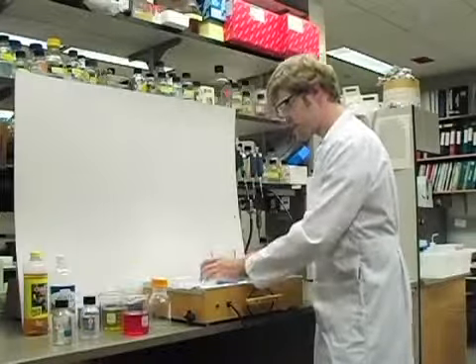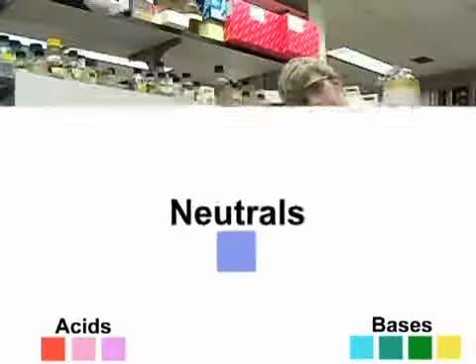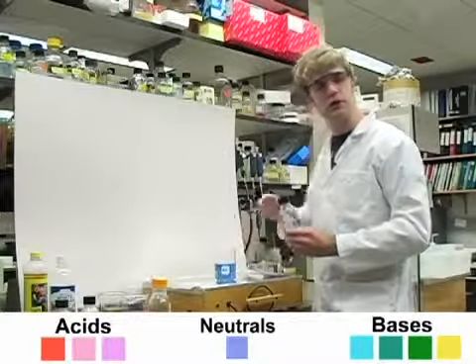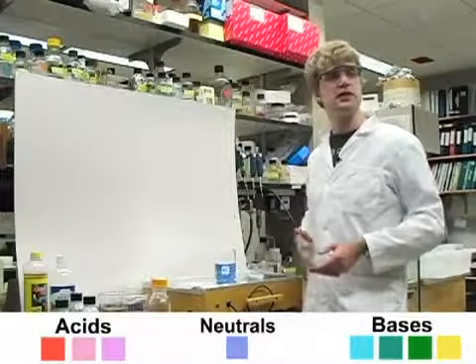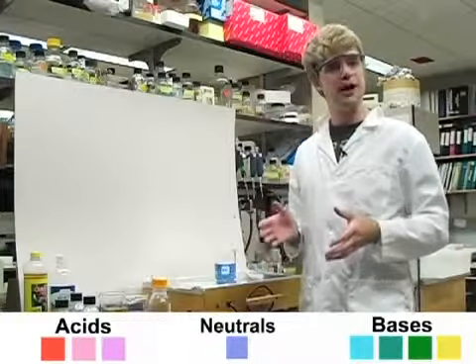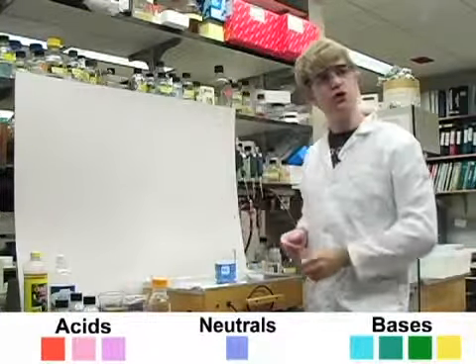That's because this compound, this chemical, we call it neutral. It's not acid and it's not base, so it doesn't change the color of the indicator. We can add as much as we want and the indicator's just going to stay the same color. So those are our three categories of chemicals: acids, bases, and then those that are neutral.